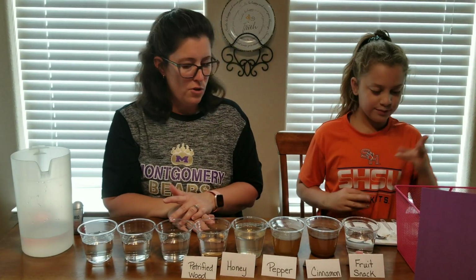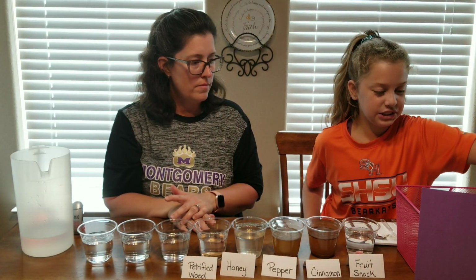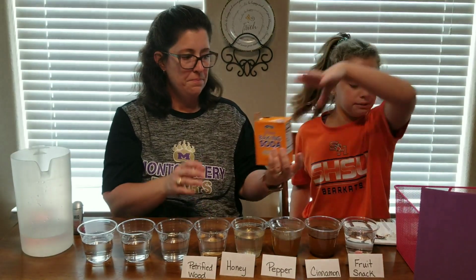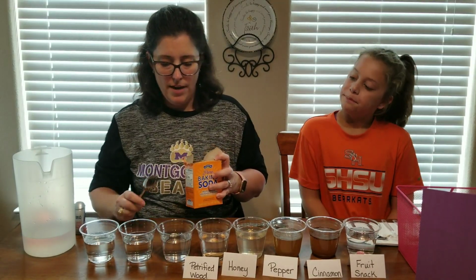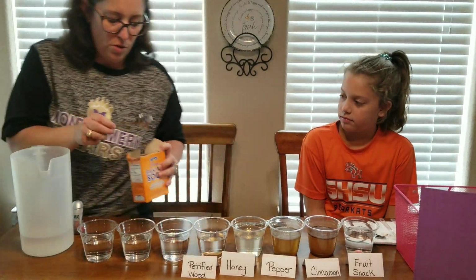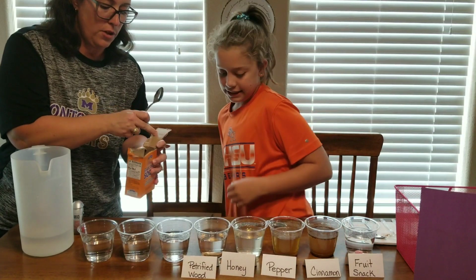Okay, we have another mystery substance. Let's do baking. Sounds good. We have some baking soda. And I can scoot out of the way, out of the picture, so Carly can come over here and stir after I put it in.